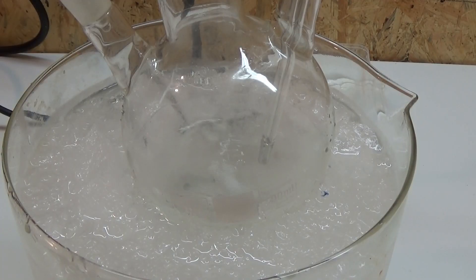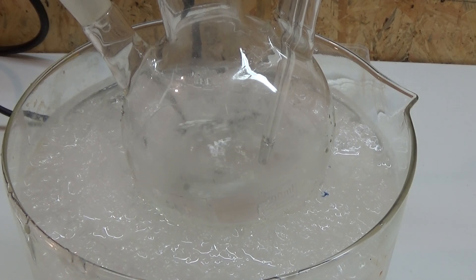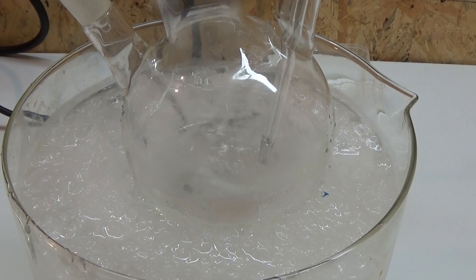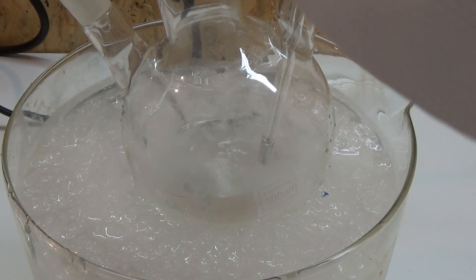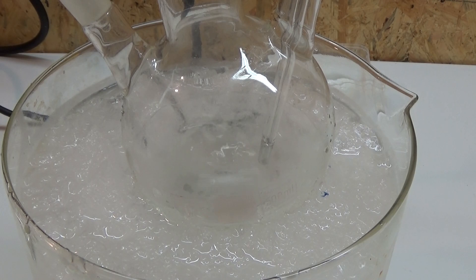We'll begin the addition of the sodium to our first educt and the catalyst primer. This should be done slowly because the reaction of the ethanol and the sodium form hydrogen which could ignite. This step has to be done in an ice bath to ensure a safe reaction.